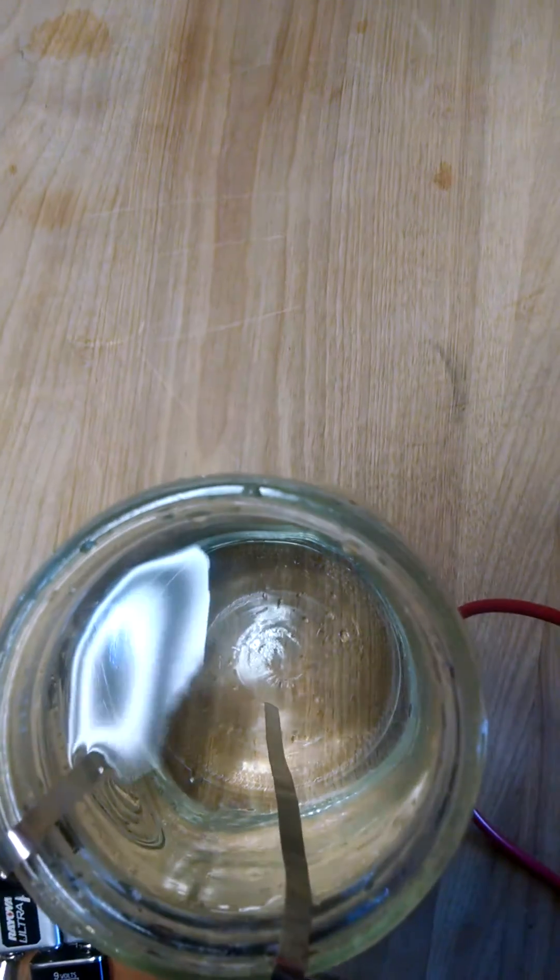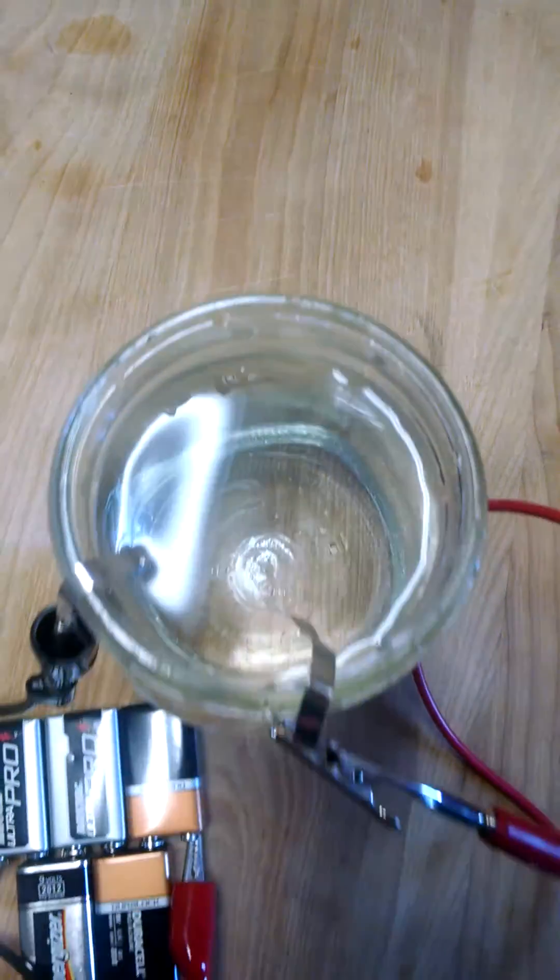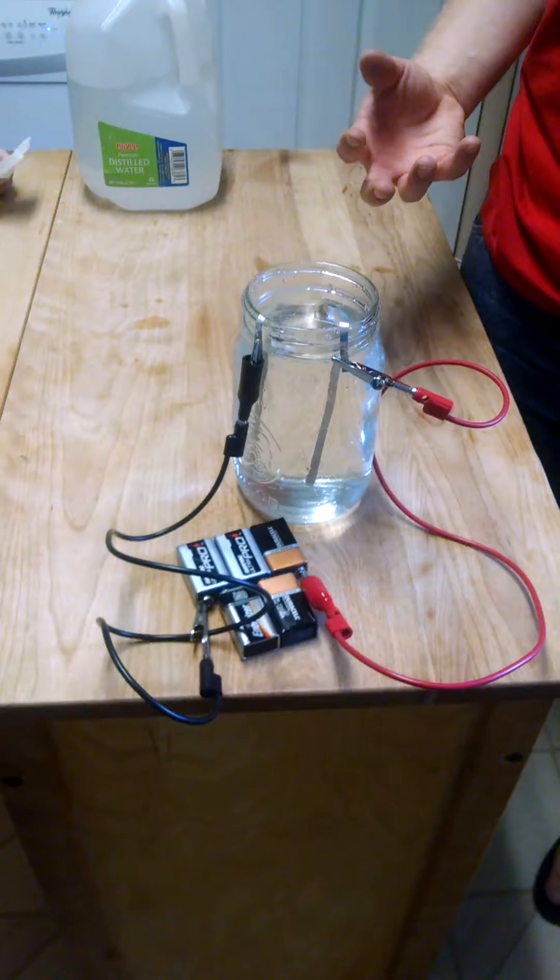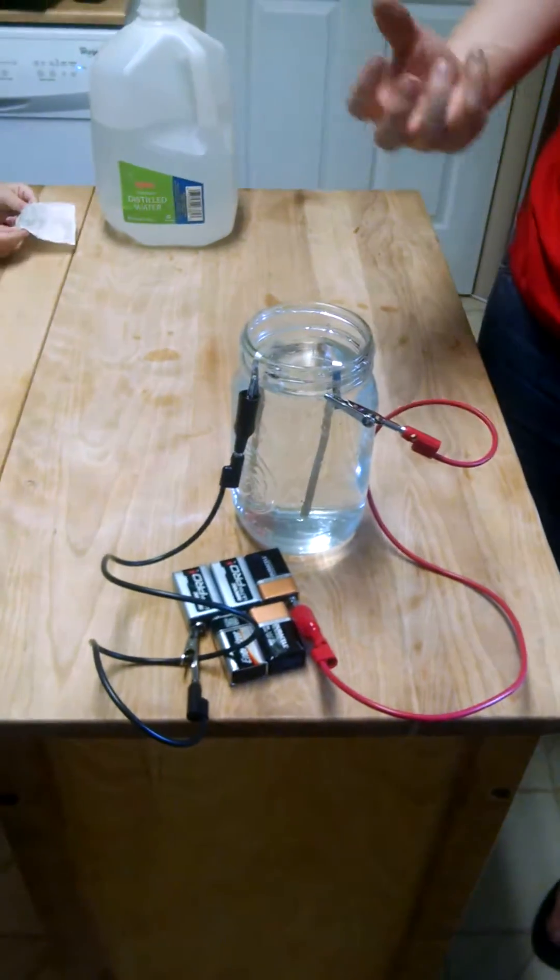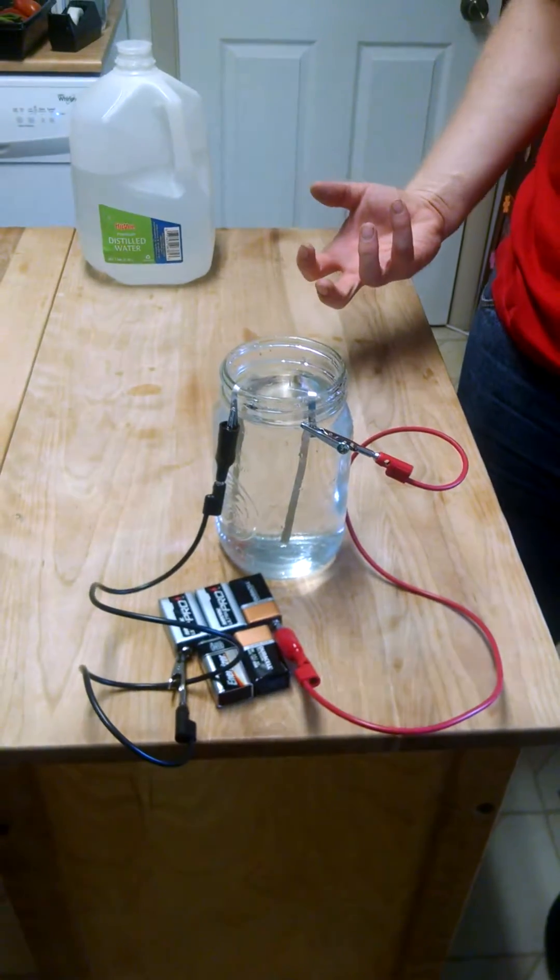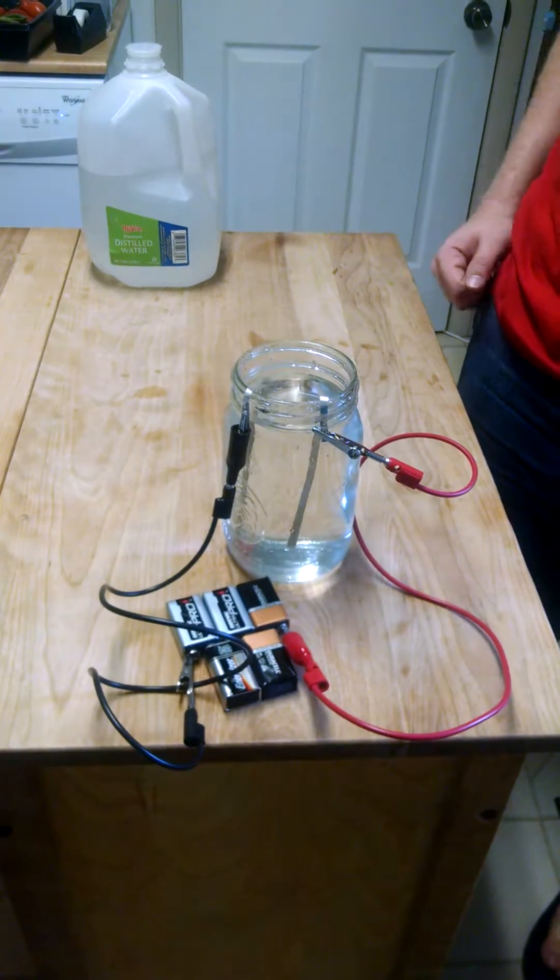And that'll take about 45 minutes, and you'll start to see a mist come off of one lead. And then it'll start getting black, and then the other lead will start getting fuzzy. And that'll be about it.